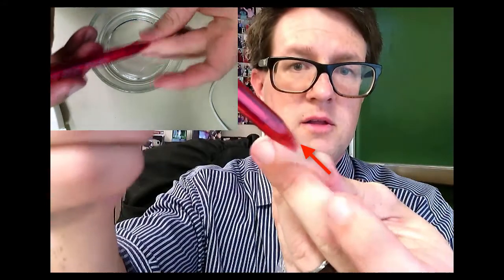Take one out — I'll have a little video off to the side showing me do this — but if you put the end between your fingers and just run it back and forth, eventually you'll open up a hole in it. You can actually stick a pen inside. Now that you have a bag, you can do something with it.